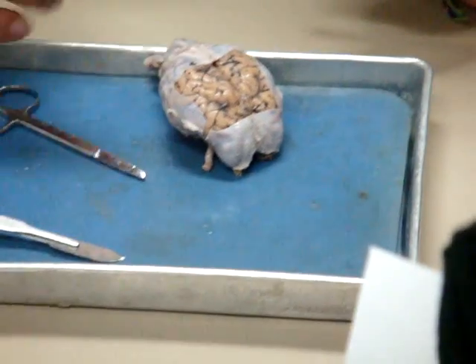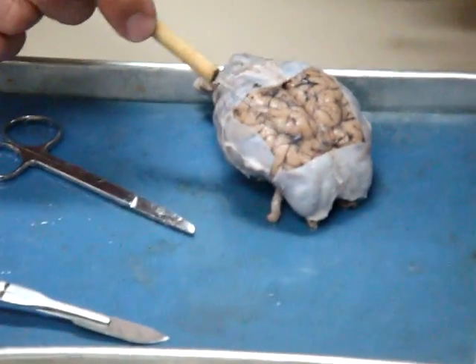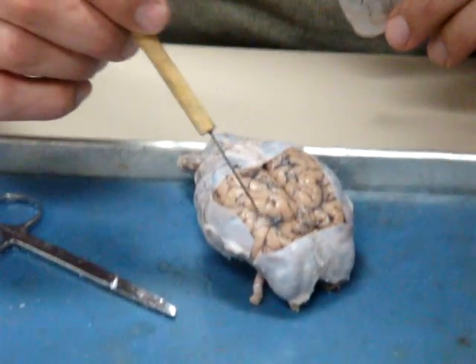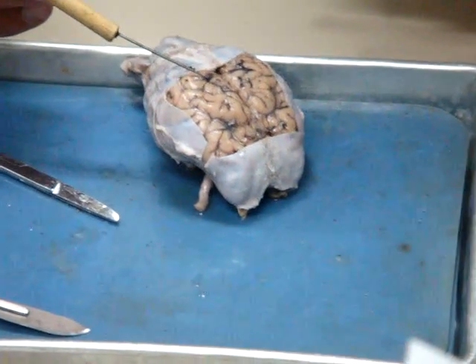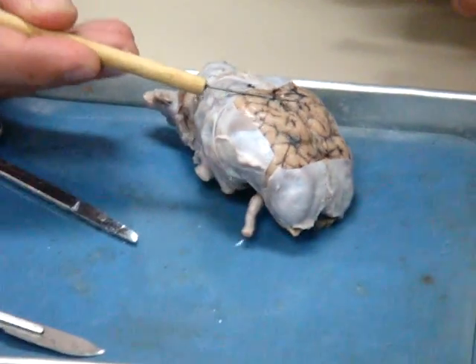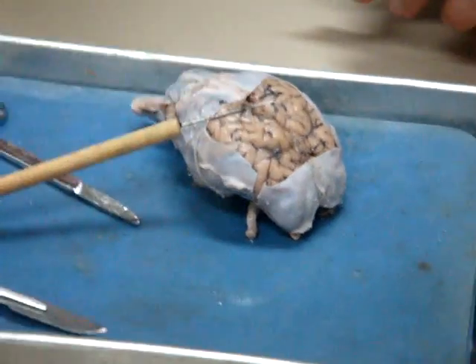Just the shininess on the surface, that's the pia mater. It's right on the surface there. And actually in the sulci, you see the sulci? Between the gyrus and the gyri. There's blood vessels in there, and they're inside this pia mater. That little shiny kind of stuff that you see me peeling up, that's the pia mater. Okay, like my probe is going through the pia mater. Is it throughout the whole brain? Yeah, it covers the entire brain.